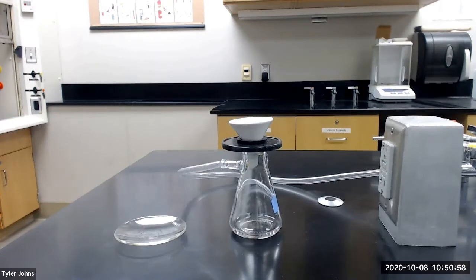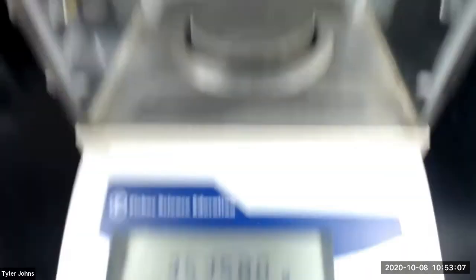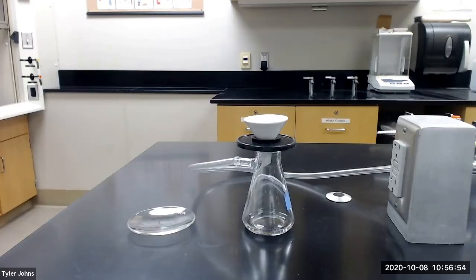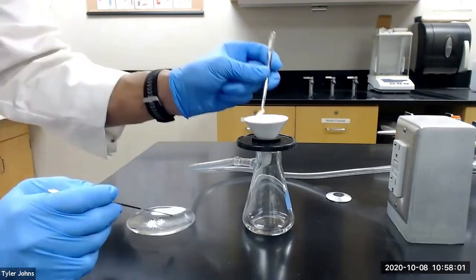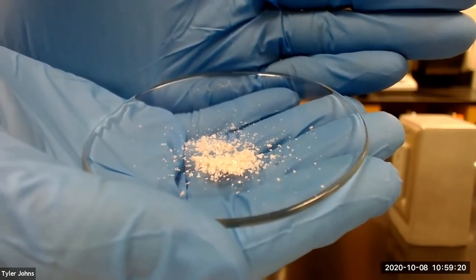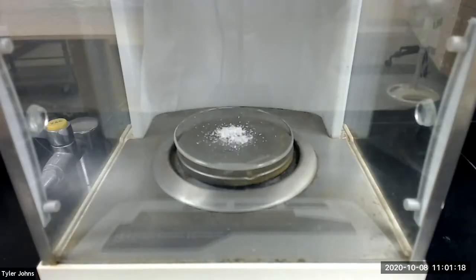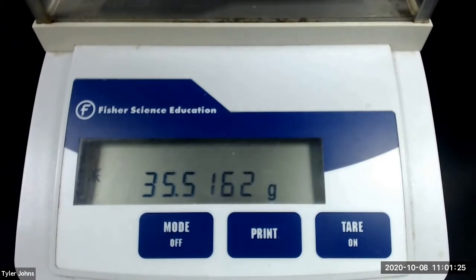While our crude acetaminophen crystals continue to air dry, we need to pre-weigh a watch glass. The mass of our pre-weighed watch glass is 35.3580 grams. We now need to collect our crude acetaminophen crystals on our pre-weighed watch glass. We next need to determine the mass of our crude product. We will set aside a small amount for melting point determination. The mass of our pre-weighed watch glass and crude acetaminophen product is 35.5162 grams.